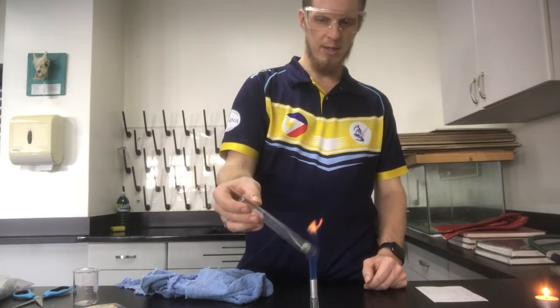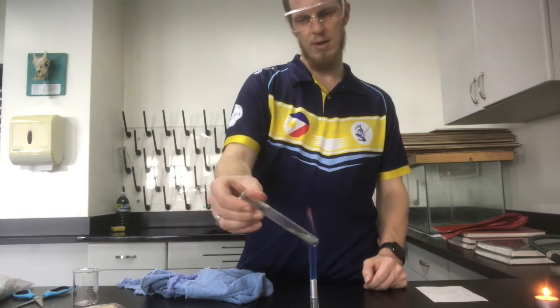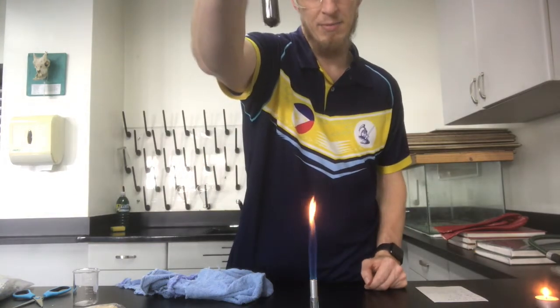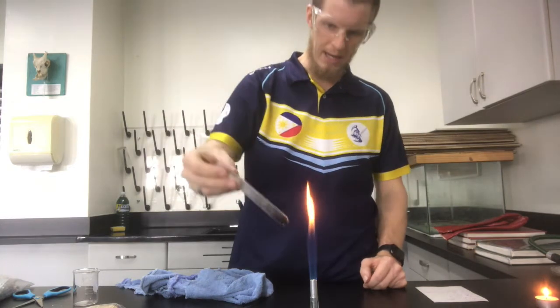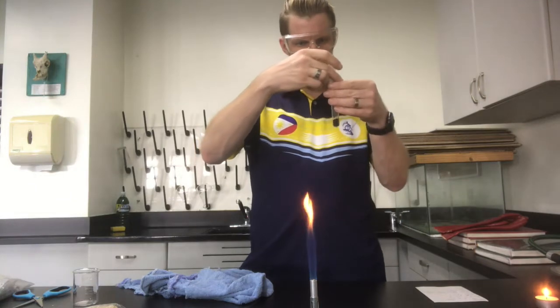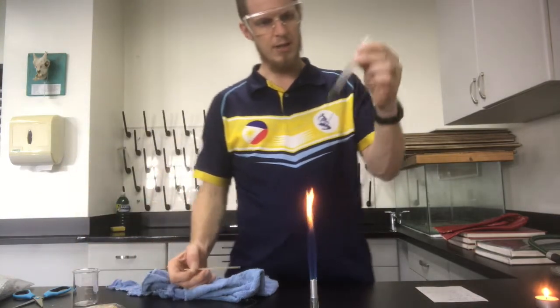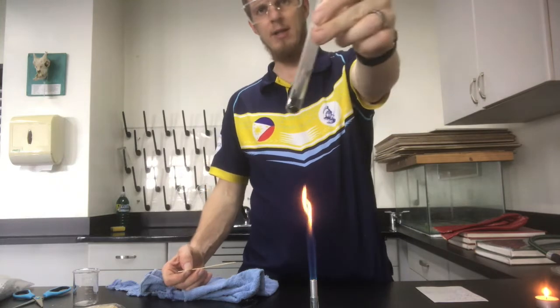We would take a sample and measure it, and then heat it up. Well, we couldn't heat it up, because obviously heating it is making a difference. We can see there that it's turned black. Going back to my point before, we'd have to dehydrate it and work out what our waters of crystallization is. So we can see that it's changed.